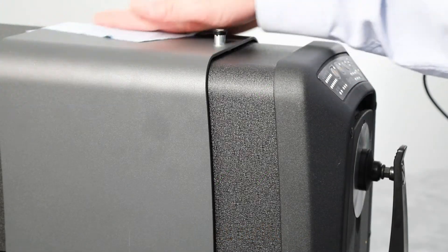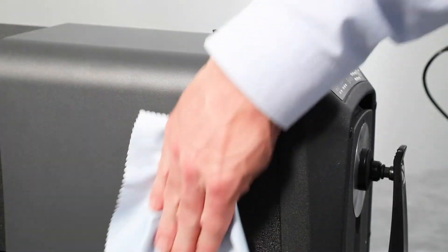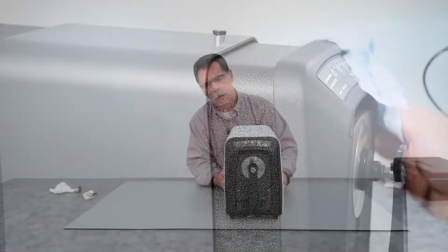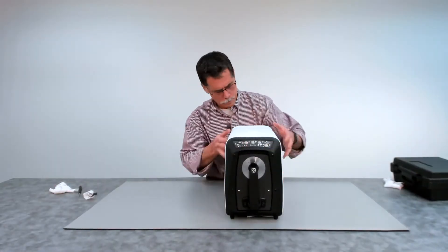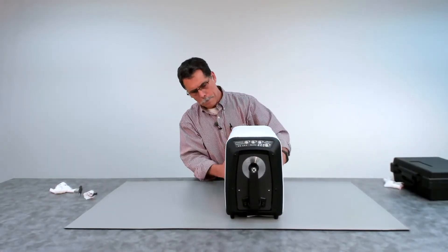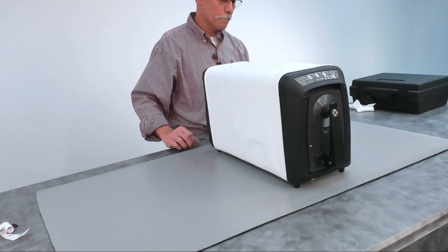The exterior should be cleaned from dust using a lint-free cloth on a weekly basis. If you're in an environment with high amounts of dust, we recommend using a dust filter kit to keep it protected.